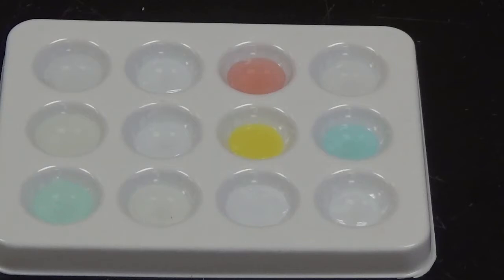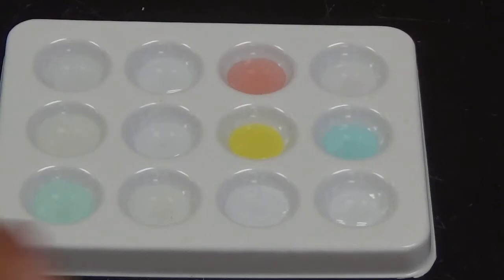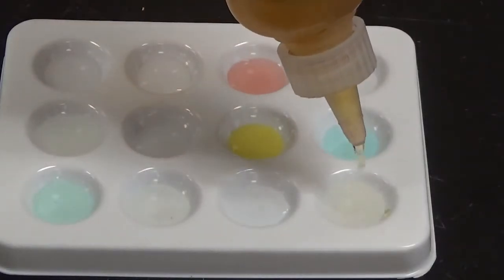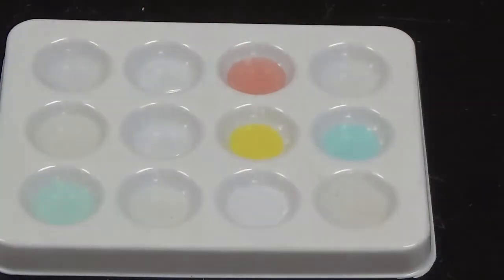And then finally, to this one right here, we're going to add iron 3 nitrate. Iron 3 nitrate has this gold color, and it has the formula Fe(NO3)3. Oh, you can't see it if I add it that way, sorry. And nothing there but a dilution of color, so no chemical reaction. Okay, so that is sodium phosphate with all of the other substances. So let me switch my trays out.